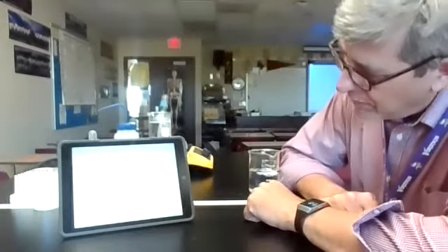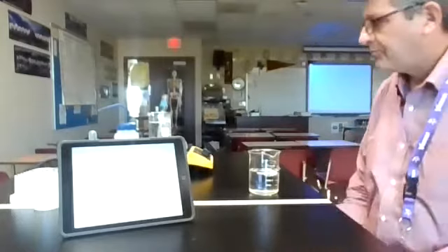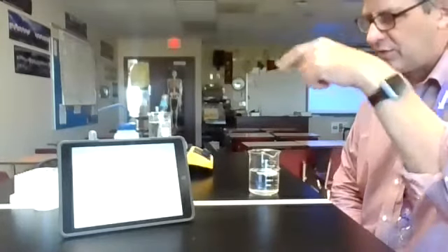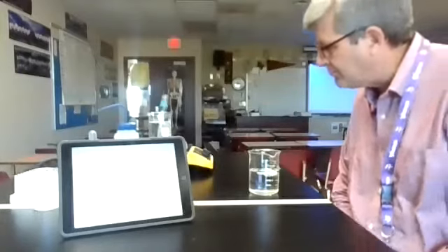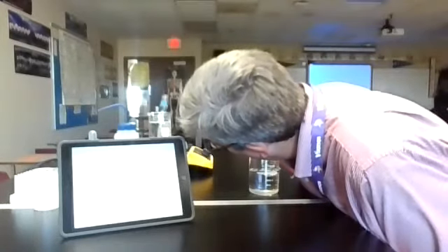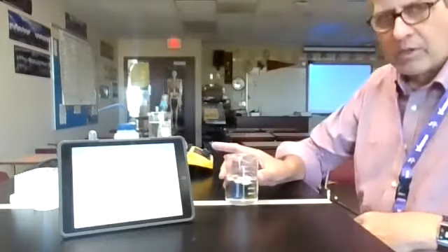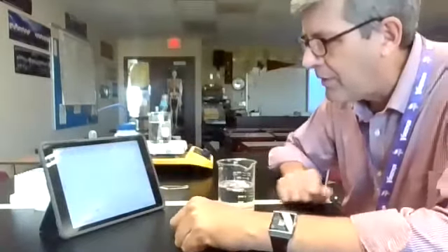I've got about 1 minute left here. We're getting close to 80. We're not quite all the way up there, but we're getting close. And it's a gradual rise. If this was water, it'd be a much steeper rise as you would watch it go up, but it does work all right. Yep, we have pretty much all liquid in there now, so that worked okay. We'll go for about another half a minute, and then we'll watch what happens here with the cold water bath.